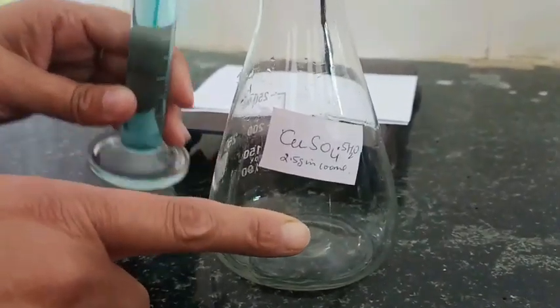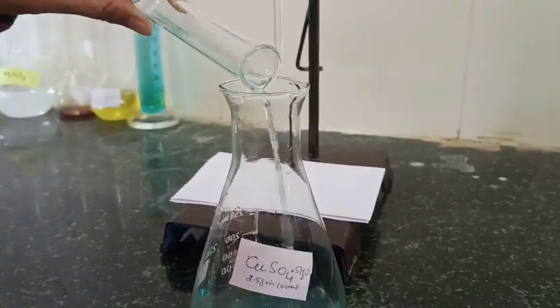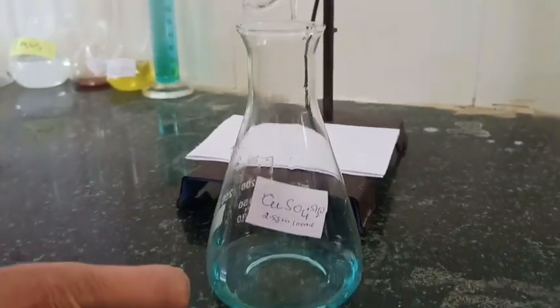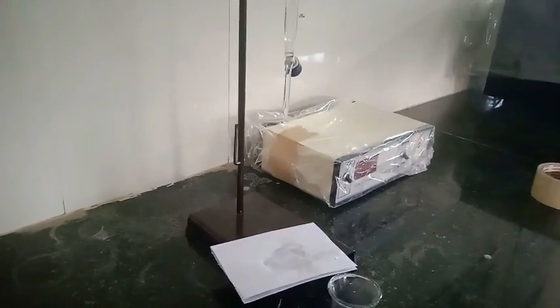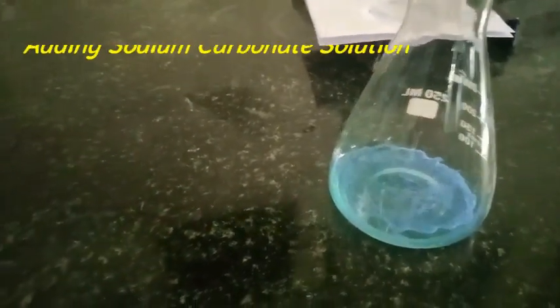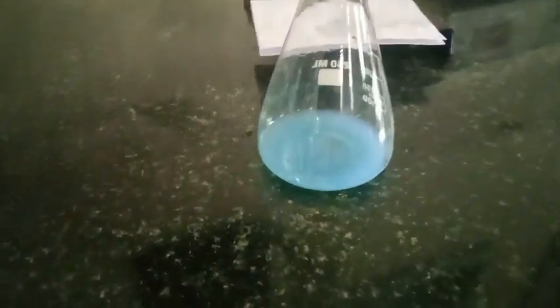I am preparing the copper sulfate solution: 2.5 grams in 100 ml. Now, 25 ml of this copper sulfate solution is taken in a conical flask. Since the copper sulfate solution is slightly acidic — about pH 3.5 as mentioned on the container — we add a few drops of sodium carbonate to neutralize it. We continue adding sodium carbonate until we get stable precipitates.